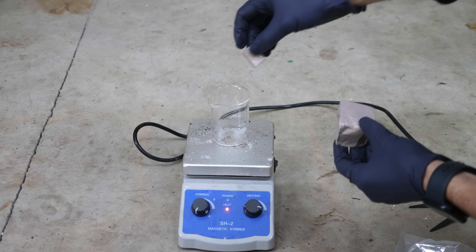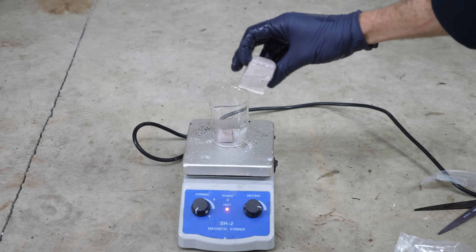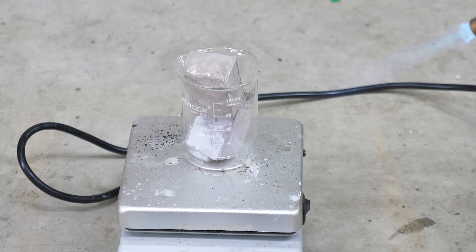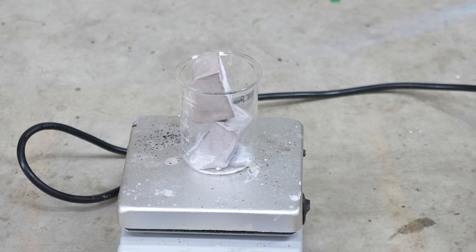First, let's melt down our huge chunk of sodium. So I didn't know what to expect if I melted down some sodium into its liquid form and then dropped a chunk of solid ice in it.